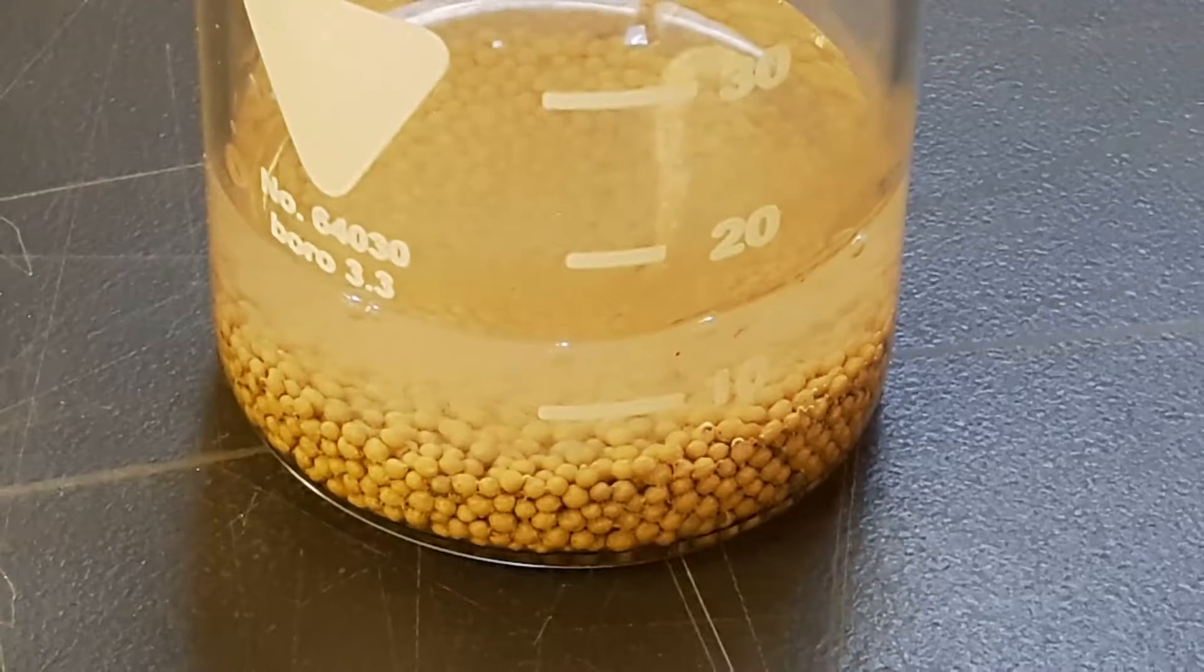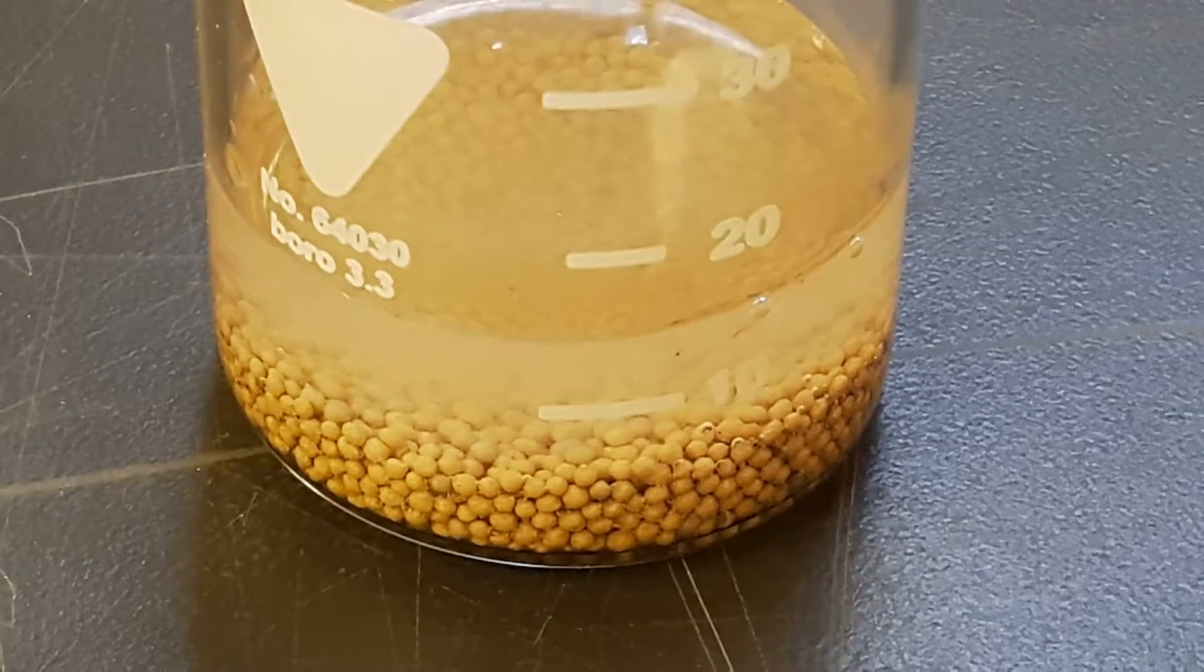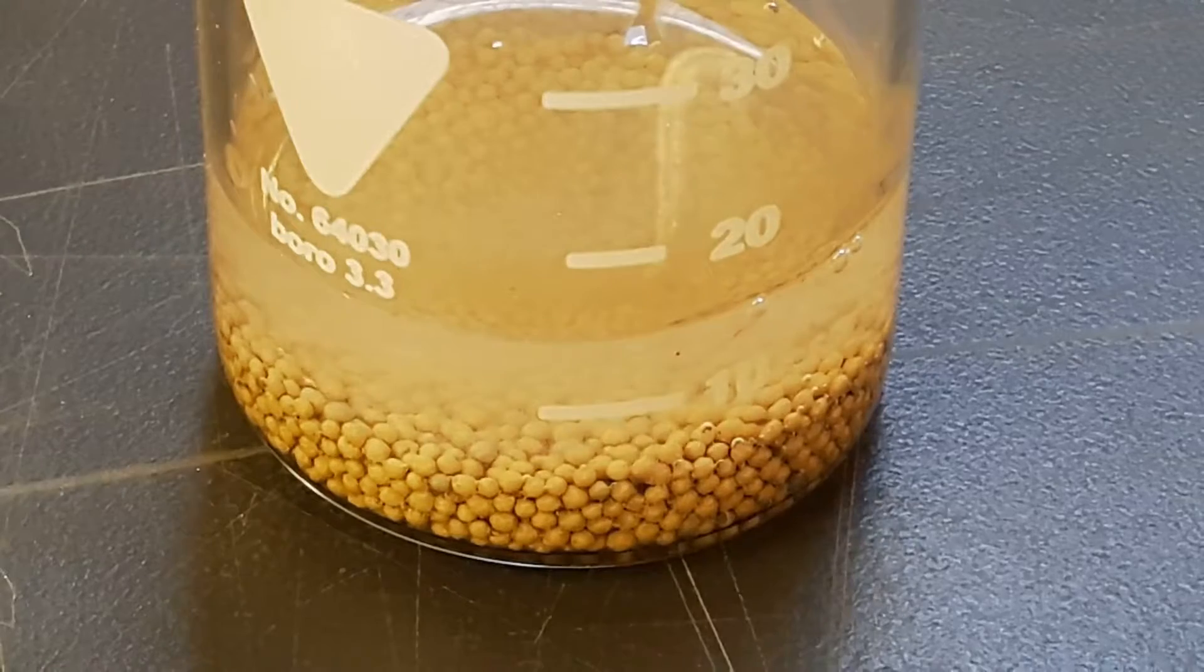Here I just watched if there is some heavy bubbling, but it didn't seem to bubble much, so I thought everything was okay.